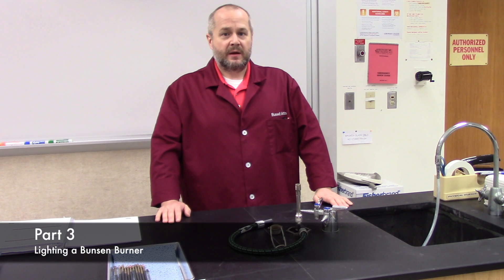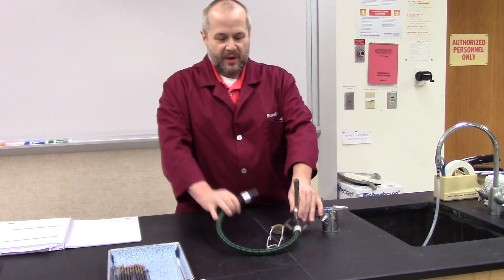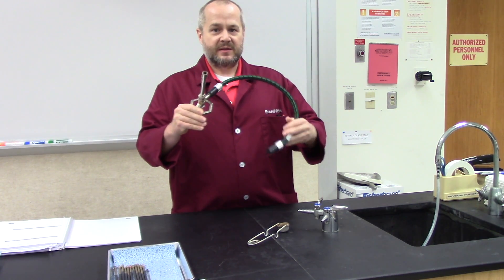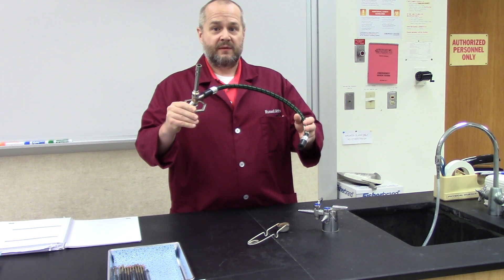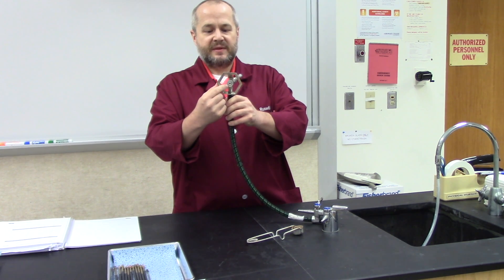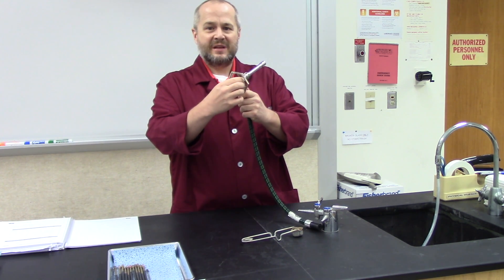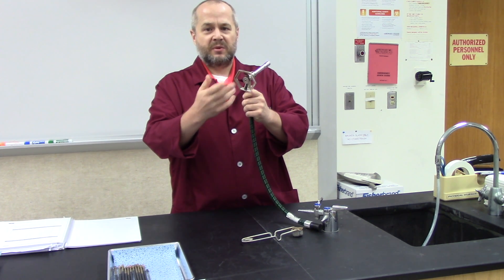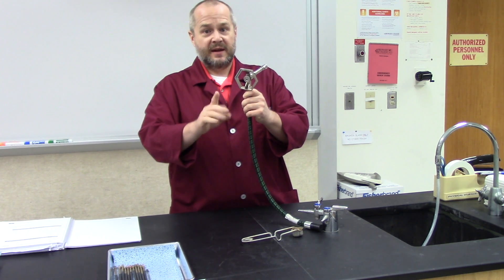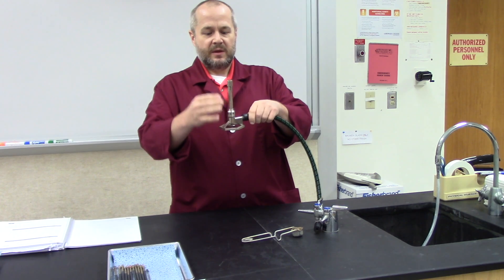Part three of today's experiment requires the use of a Bunsen burner. Allow me to show you the proper and safest way to light one. The first thing we want to do is make this burner as safe as possible. On the bottom of the Bunsen burner you'll notice a small circular wheel — take that wheel and turn it all the way clockwise until it gets snug. This is known as the needle valve. Having it turned all the way to the right, snug but not tight, means it's completely off — no gas can get to the combustion chamber.